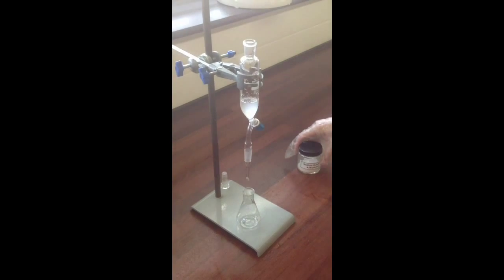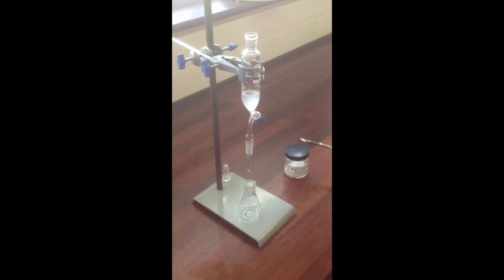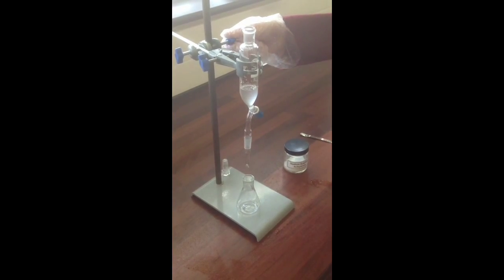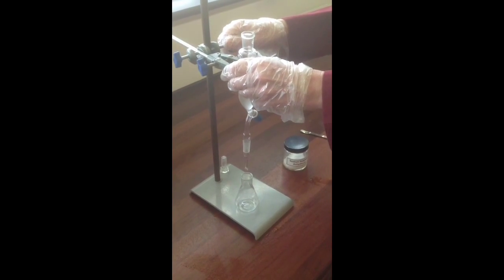So we've done some of the work now of purifying our product, but you'll see it's probably cloudy at this point, and that's because there's traces of water contaminating it from those washings. So we need to do a strange thing. We need to dry it, which sounds like an odd idea, drying a liquid. We'll see how it's done.